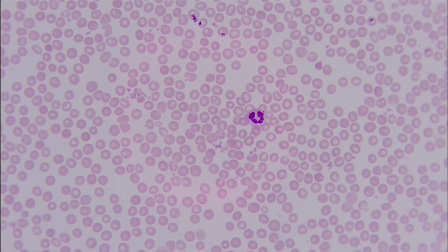Next, we have blood. Circling back to it from earlier, again, we can tell that there are no organelles in here. They're kind of just blank cells, right? There are red blood cells. But we can tell there's a lot of different stuff around here, but primarily we just got to know this is blood. You'll get into what these are in A&P too.